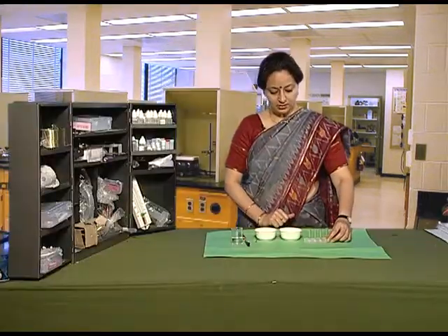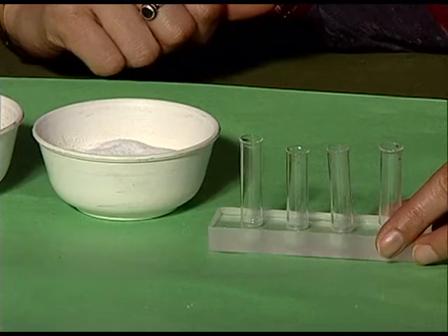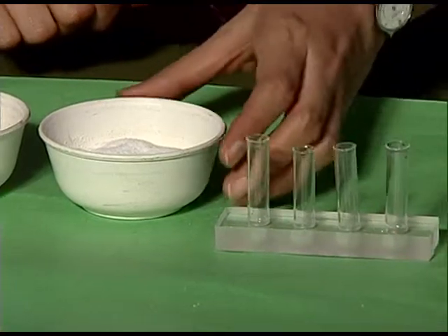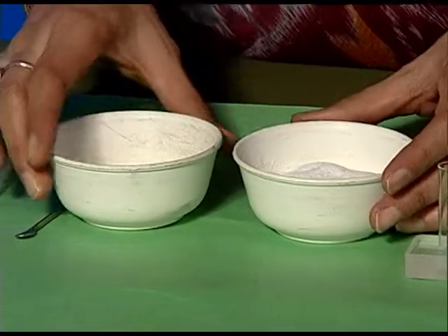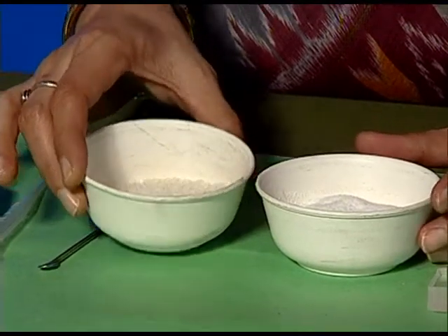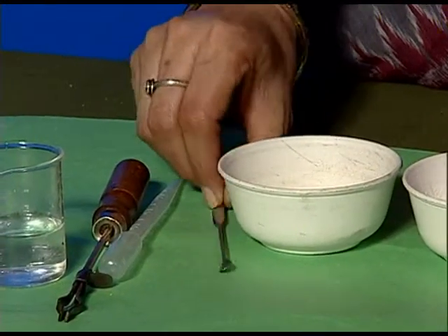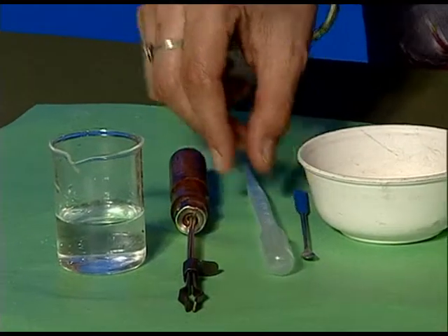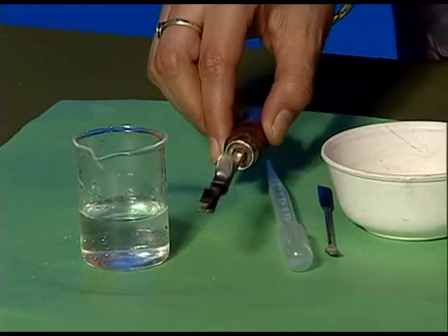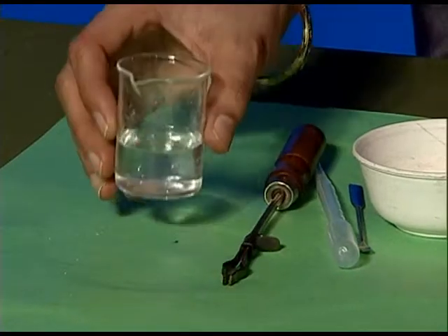For this we need test tubes, a test tube stand, salt, sugar, a spatula, a dropper, a test tube holder, and water.